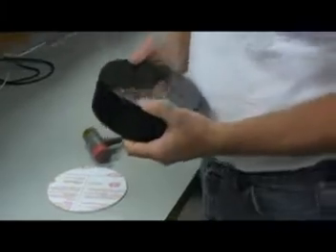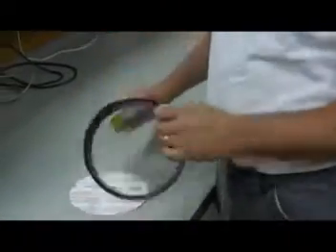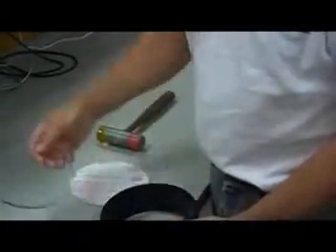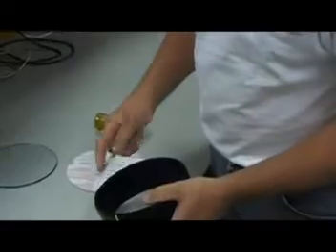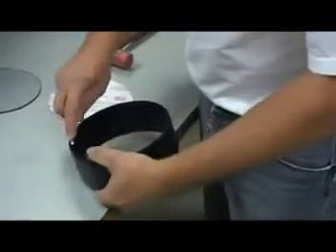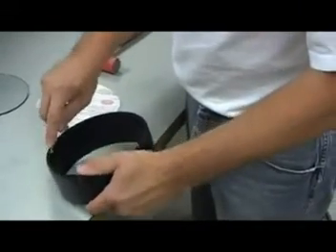We'll begin by removing the old polycarbonate disc from the sample holder. A rubber-faced hammer, one sharp blow. If you don't have a hammer, maybe a blunt stick, one quick blow should pop the old disc out. It probably won't break, so you shouldn't have any problem there.